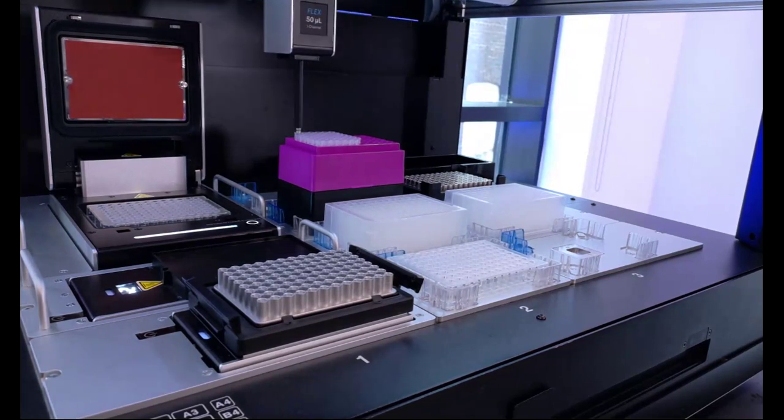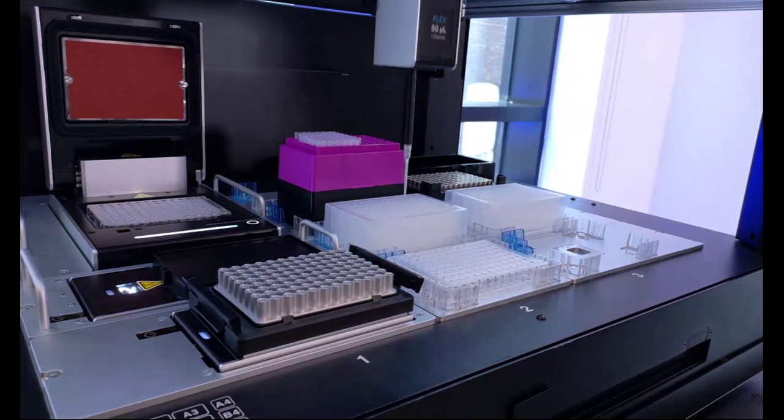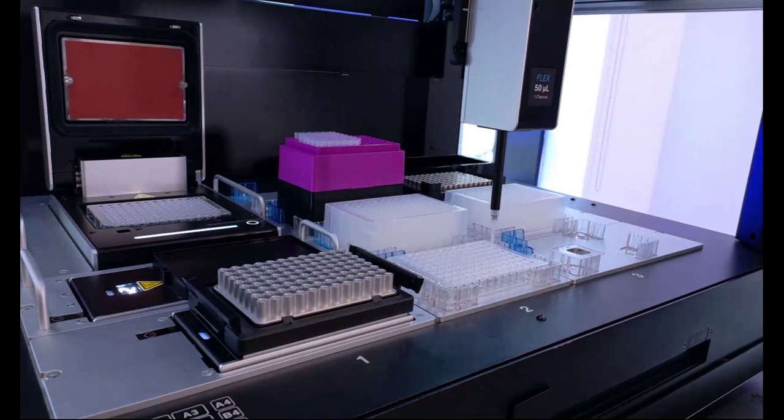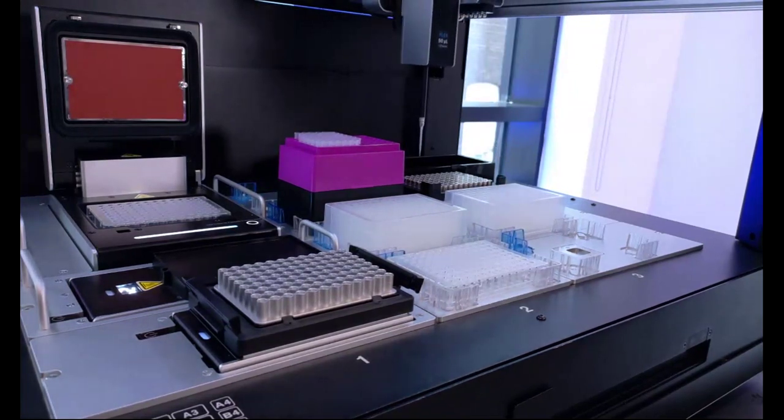We're really hopeful that end users in the lab who aren't as familiar with automation will have the comfort to walk up to the instrument and interact with it in this manner, and hopefully continue from there. This is a fantastic introduction to how the system and how automation overall can benefit your lab space.